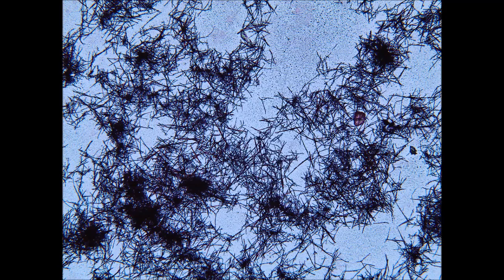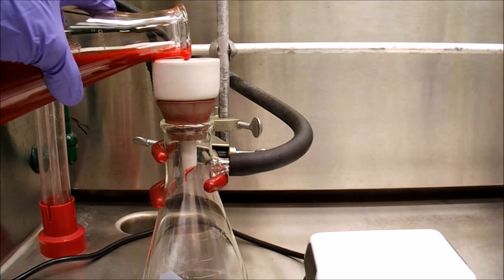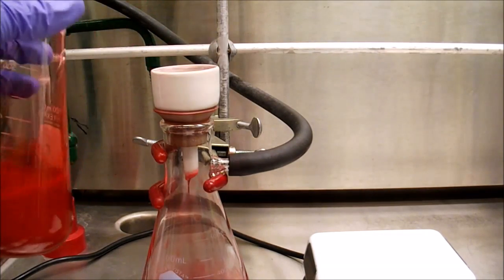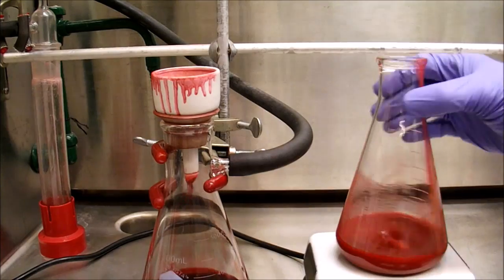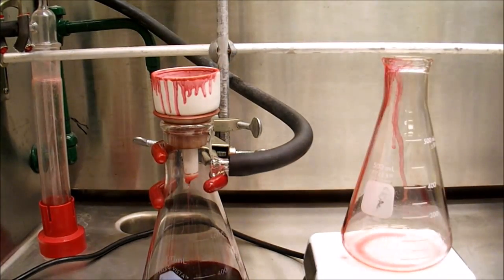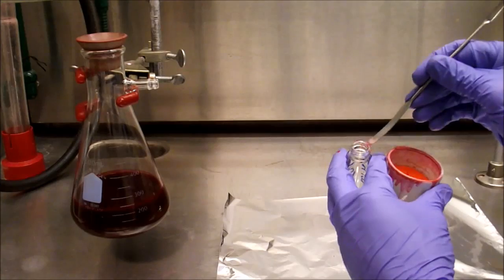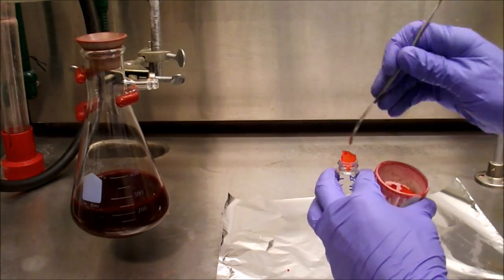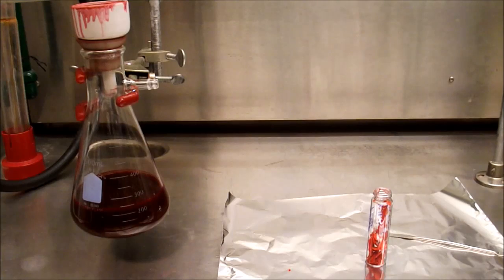To prove that these are in fact crystals, we can look at a sample under a polarized microscope. Under normal light the material looks like small needle-shaped crystals, and under cross-polarized light the crystals light up, clearly showing that the needles are in fact very small crystals. Since the material appears to be crystalline, we proceed to filter and isolate the solid product. The filtrate is quite dark and will probably represent a significant loss of product, but if a higher yield is desired it is possible to concentrate the mother liquor. The isolated material should be this bright orange colour; if you skip the crystallization it will be dark red and retain some impurities. After isolation we are left with 588mg, corresponding to a 66% yield.